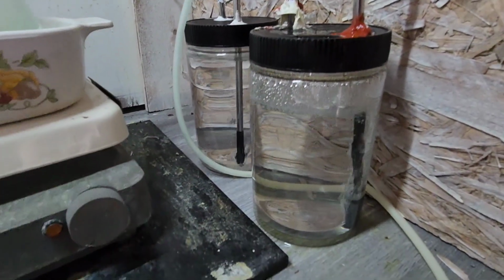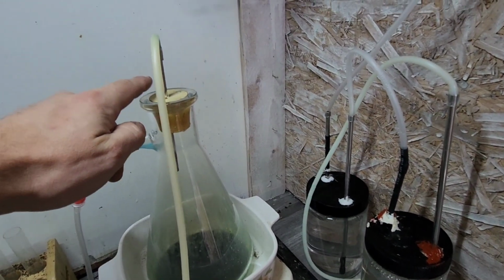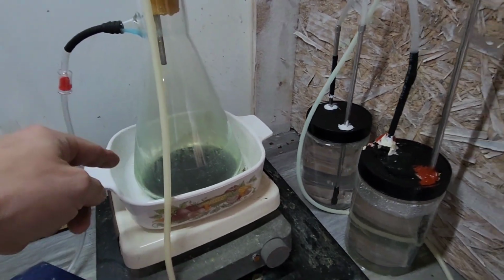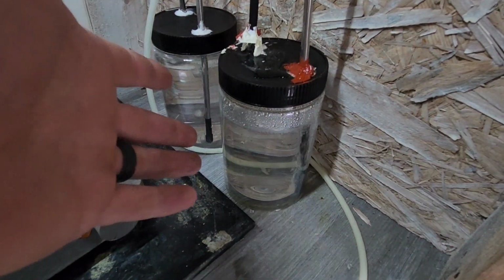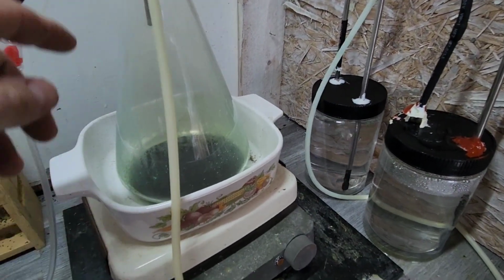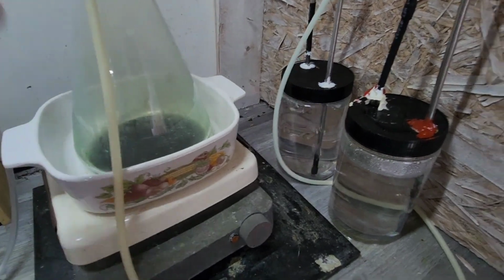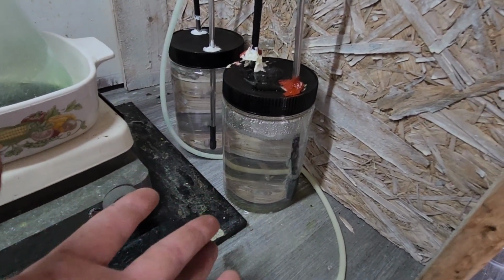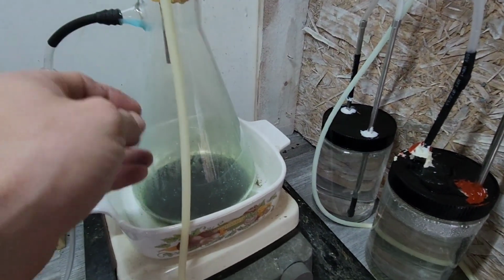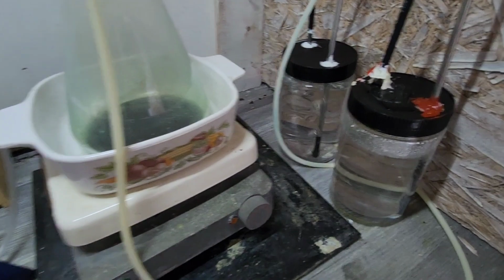So I think the first thing I need to do is get a couple of flasks, a couple of standoffs. It's easy enough just to pop that out of there. It seems like it holds the pressure fine, especially under heat. It'll give me much more storage. I'll have 1,000 milliliters of fluid, and then I'll just do two holes in these for the in and out with a longer tube. I think that should help me a little bit better, especially with it being thin, a little more narrow, so those air bubbles will have much more surface area or time with the water.